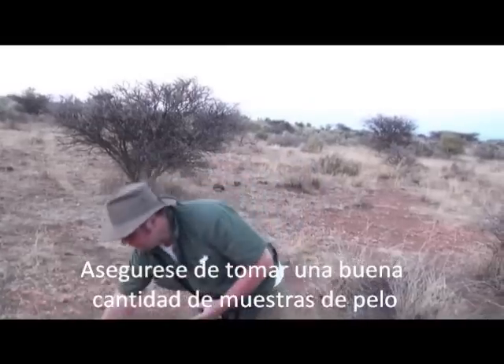And there you have it — we got a blood sample and a hair sample, took about a minute and a half. We'll finish up, and there we go.